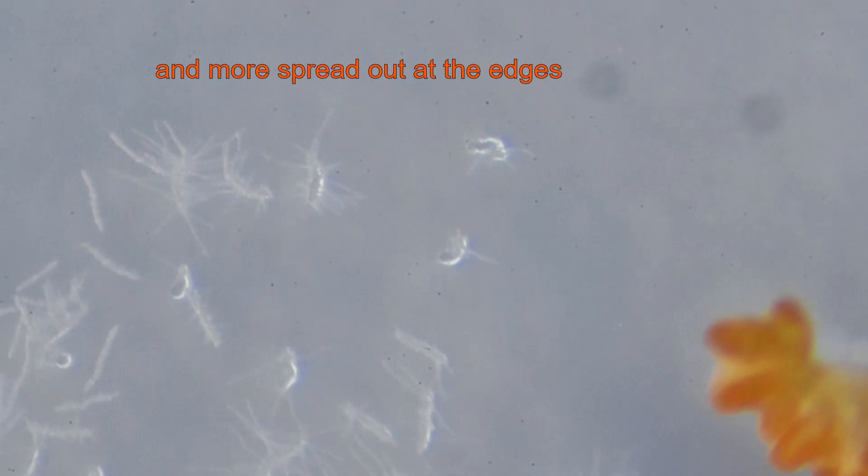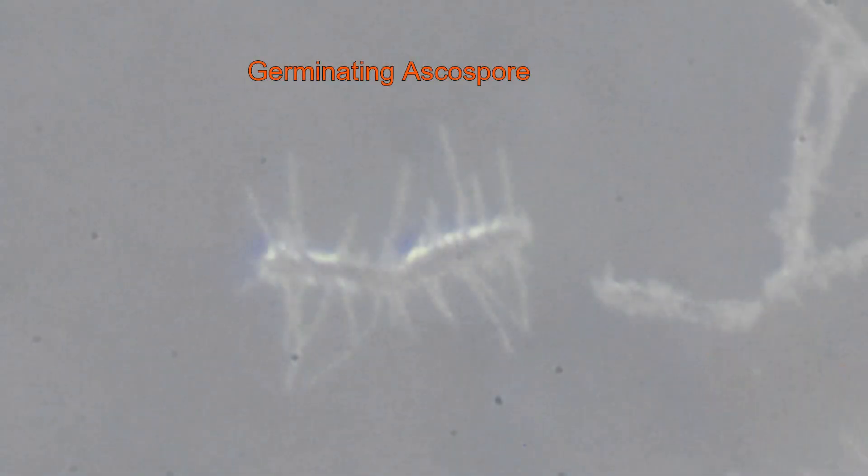Closer to the edge you start seeing individual spores so you'll be able to isolate a single spore for a mating program.